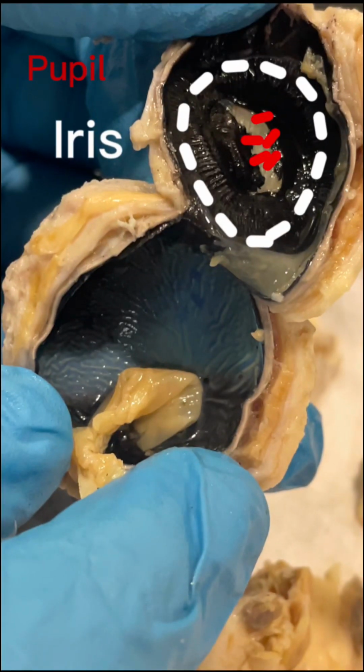This is the colored part of your eye. Muscles in your iris control the pupil. The small black opening lets light into your eye. The color of your iris is like your fingerprint, unique to you. No one else in the world has the exact same eyes.